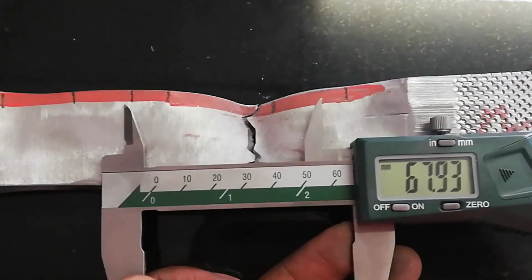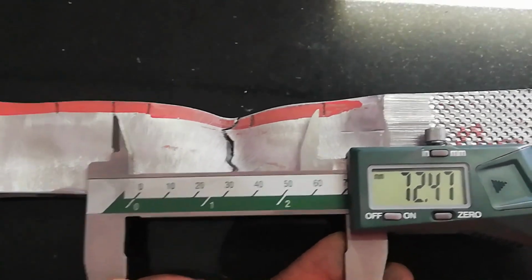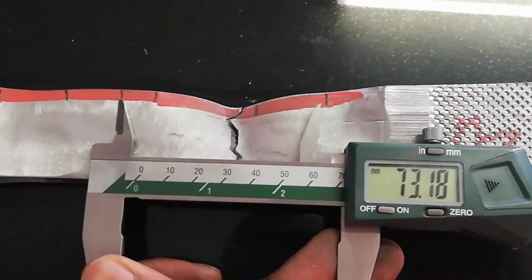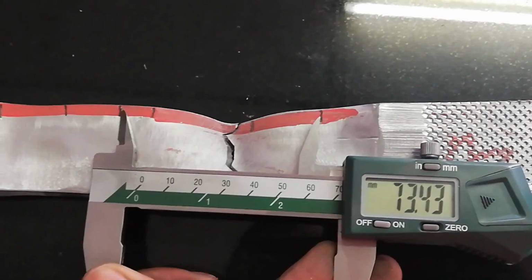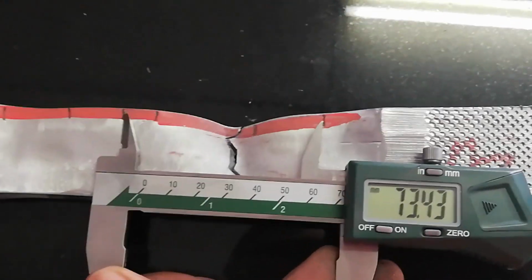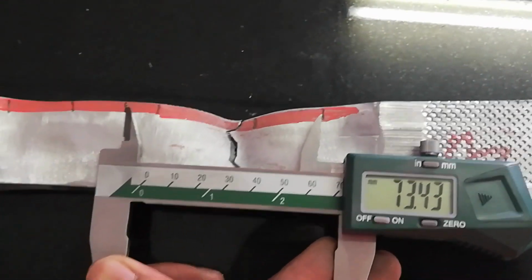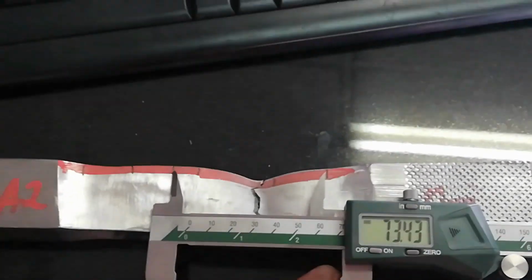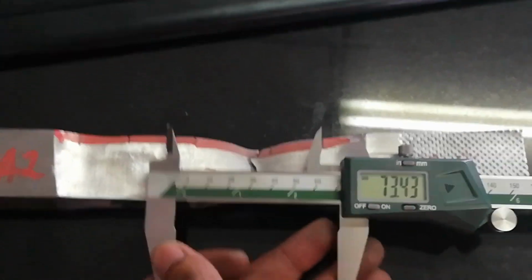That is great. So I'm going to take the biggest extension. I'm going to measure properly though. This is just to show you. So now the biggest one is 73.43. Wow. So the extension is that one minus 50 millimeter, which is 23.43 millimeter. That is a great extension. Okay. So I'm going to capture my details, my data, and save the graph. Cool then, eh? Cool.